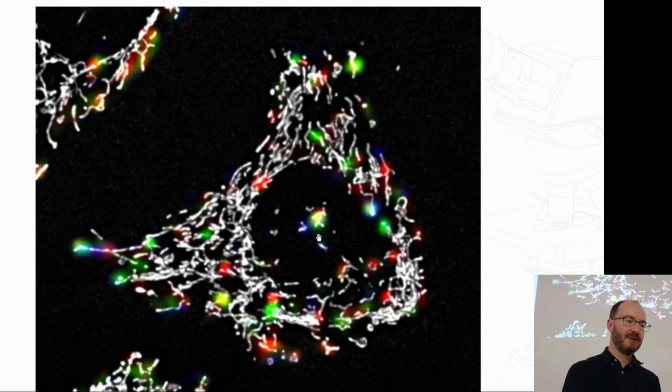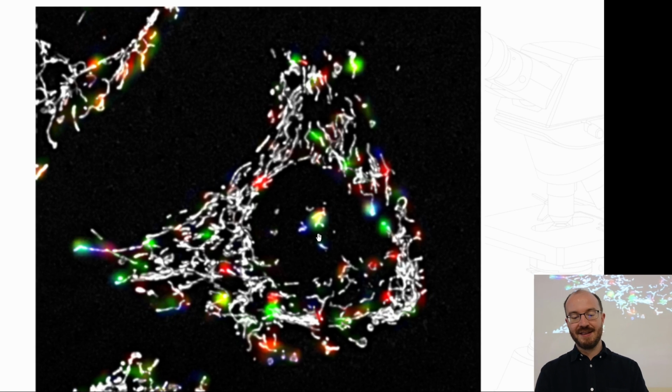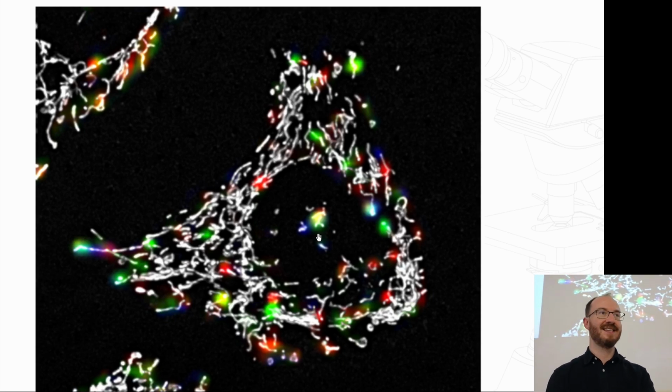But in some cases, when we looked 1 frame on, it's like, oh, it was going to fuse. It was just not within the time frame of 1. So the insight is not that you should use this on a single frame. Our conclusion is it's too inaccurate to use on a single frame. You get about 50% accuracy, so the counts don't mean that much.